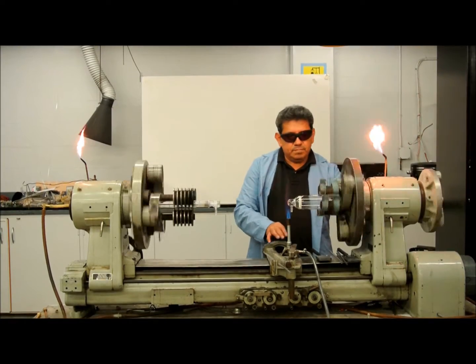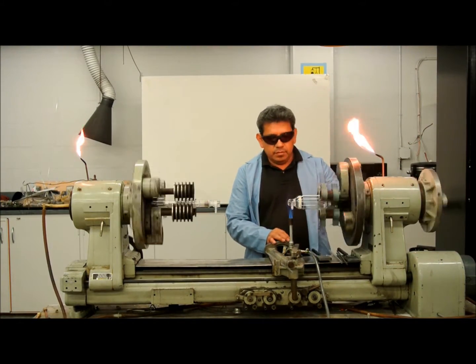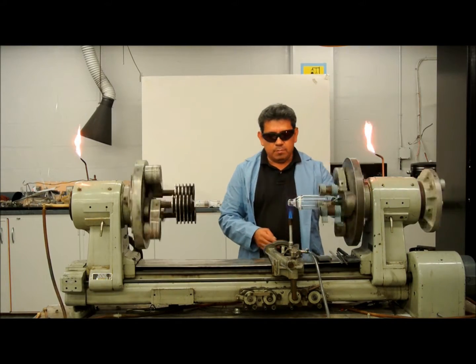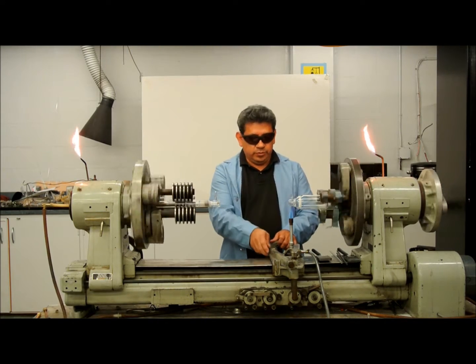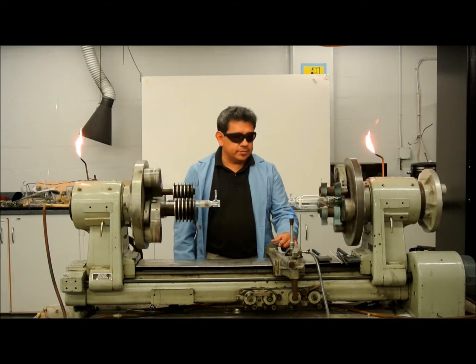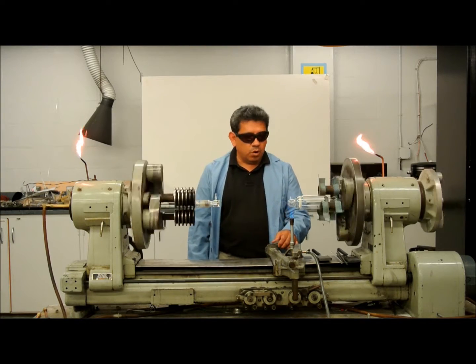Now, since there is another seal right there, there's a possibility that it can crack besides the frit. So I'm going to warm it up so that as I pull it with the top of the flame, the frit won't crack on me. Let's see what happens — it'll just take another 10 minutes or so to warm up.